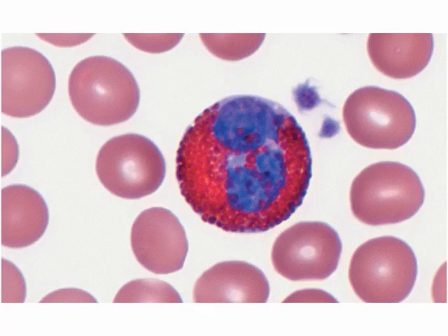All right, this next slide is on oil immersion. We see there's some platelets, blood cells, and then the cell in the middle that's really obvious. That one has distinct pinkish red granules in the cytoplasm. Now, that's the stained look. It's not going to be that color naturally, but that is an eosinophil.